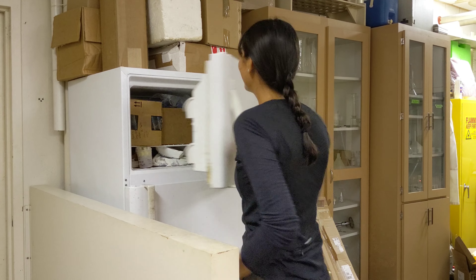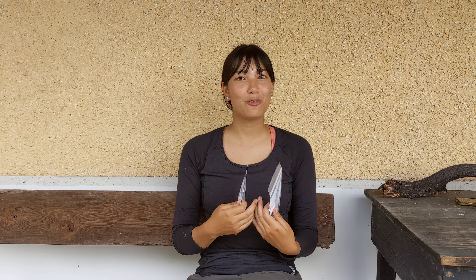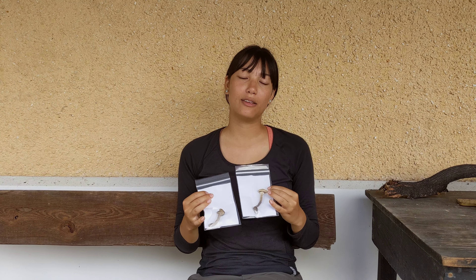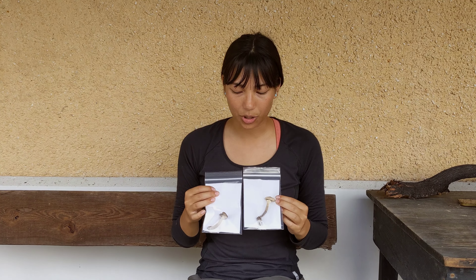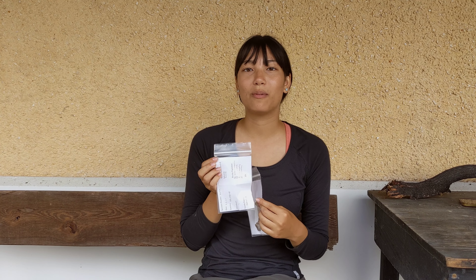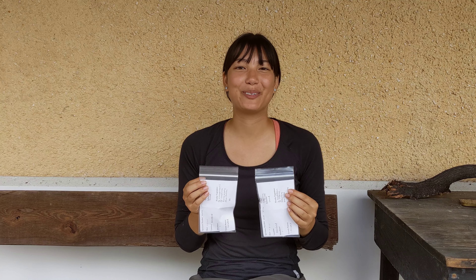Then it's ready for long-term storage. Now that we've gone over the procedure we use on specimens once we bring them back from the field, I'll show you two specimens that have already dried for two weeks in the fume hood. As you can tell, they shrink a lot in size. They're stored in these plastic bags with the same ID card that we filled out in the field. And with that, they're ready for long-term storage.